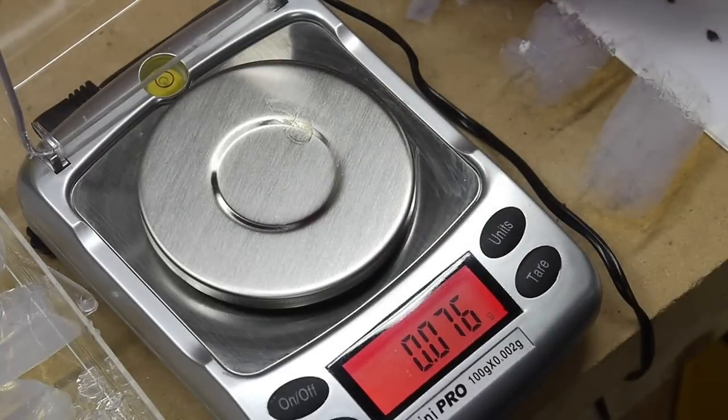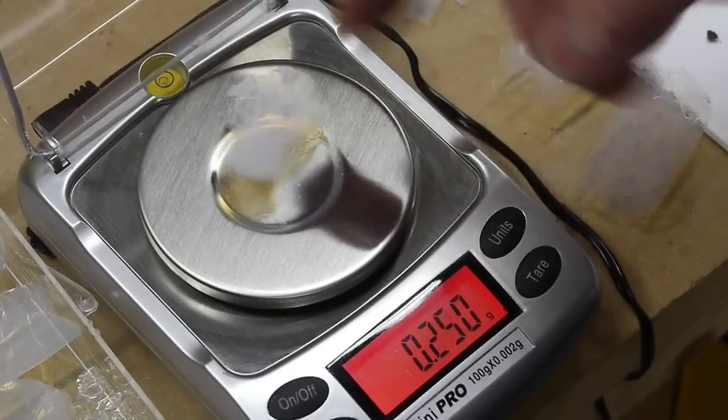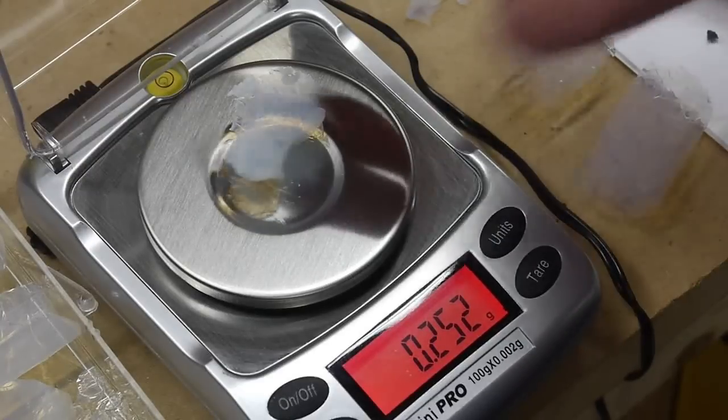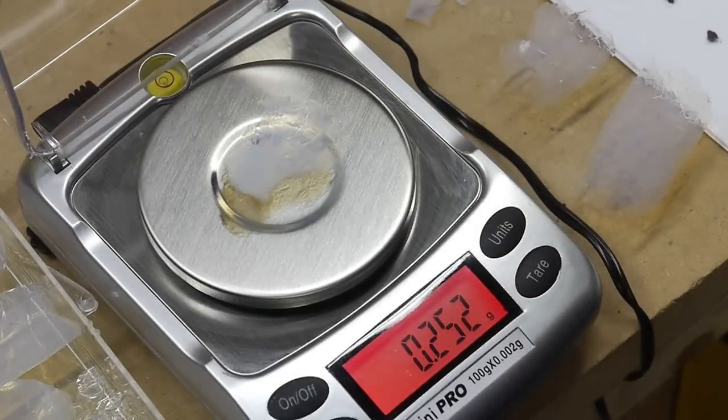So this piece is an even lower, this one's too hard to measure the volume of, but it's coming in at 250 milligrams for this piece. So that's probably the lowest density aerogel that I've made yet.